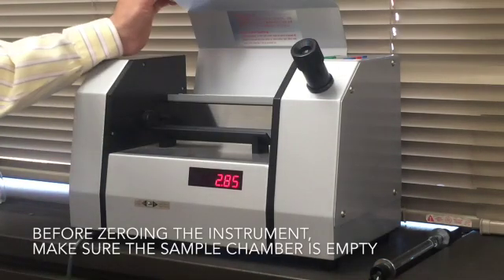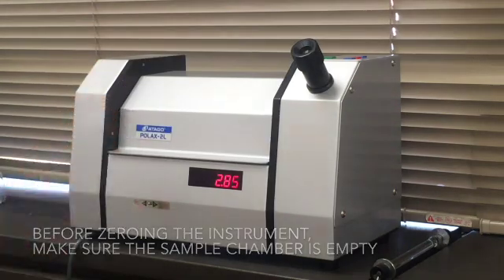Next, make sure that the instrument is empty. Now I want to set zero.